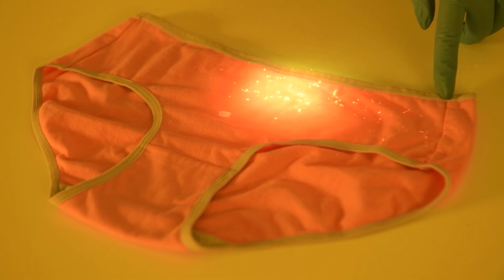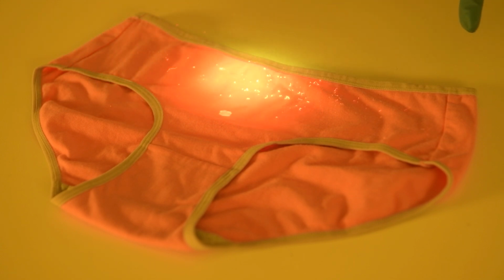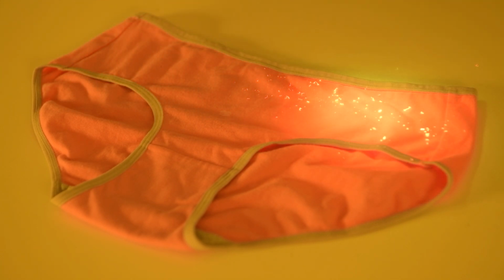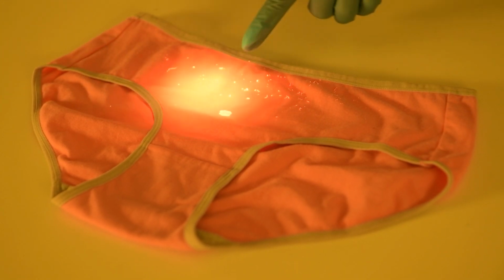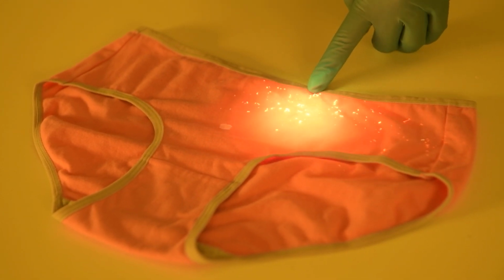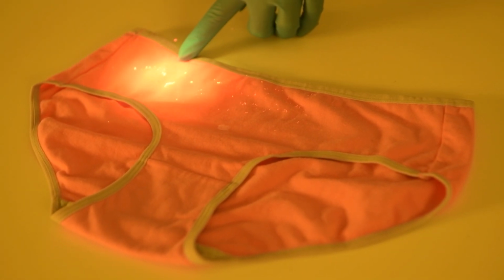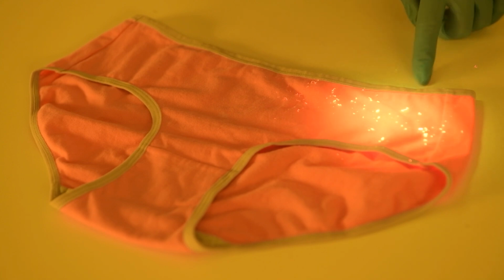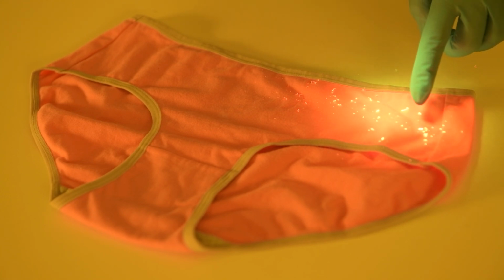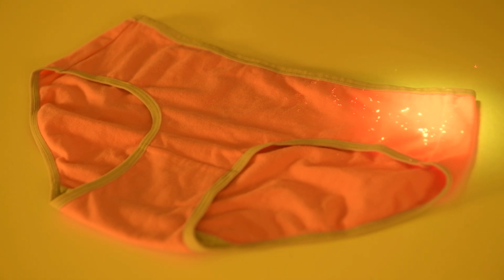But as we can see on this surface, body fluids are not the only thing that will emit fluorescence, and they're not the only evidence type that we might find. Across this surface, we can see that there are a range of fibres that have been left behind. Most of these, when illuminated with a blue light, are fluorescing an orange colour, but there are a couple which are fluorescing and behaving slightly differently.